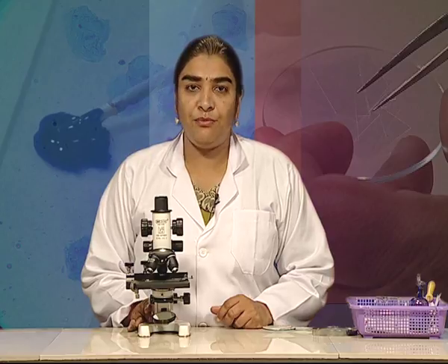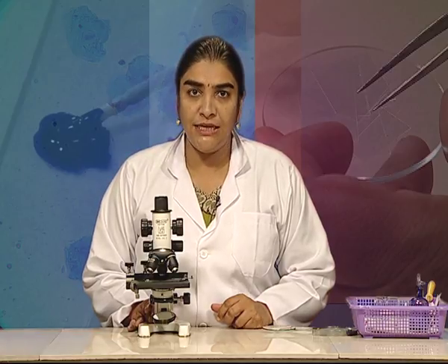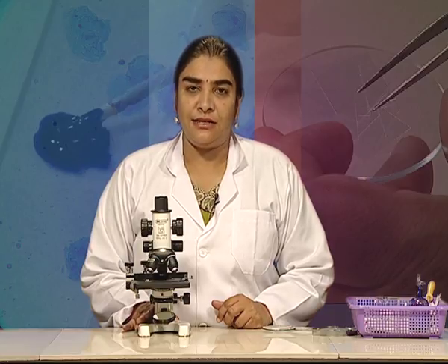Animal cells are differently shaped depending upon their location and function, but they differ from plant cells in that they have a cell membrane but do not have an outer tough covering or cell wall. They have a centrally located nucleus, not one located towards one side, and they have intercellular spaces between them very prominently present. I hope you have learnt how to make a temporary mount and will be able to make it and study the cheek epithelial cells. Thank you.